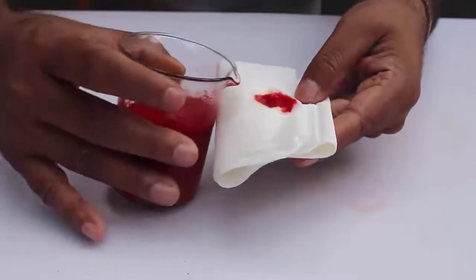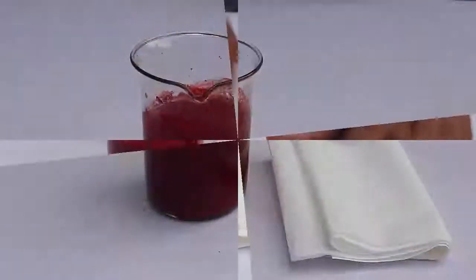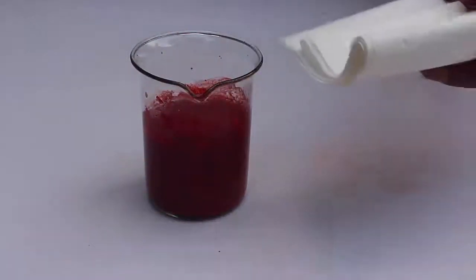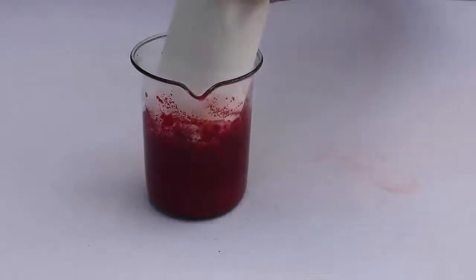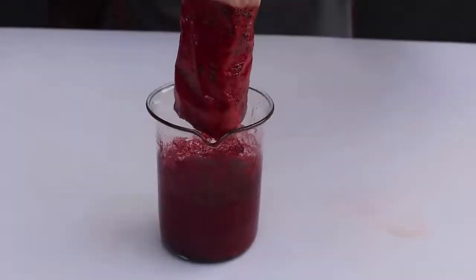Look, it is almost blood red. You can also dip some filter paper into the solution, and this is the actual process of dyeing.